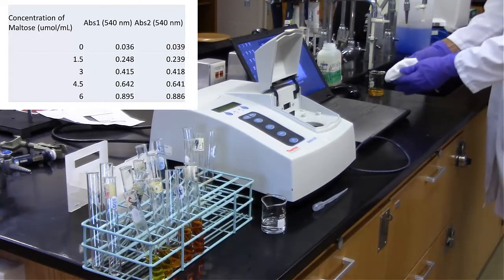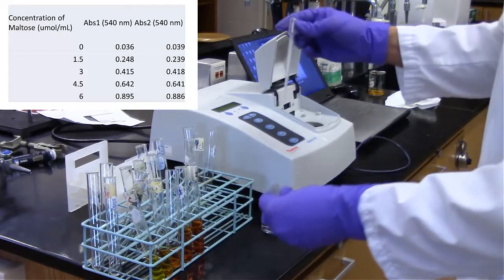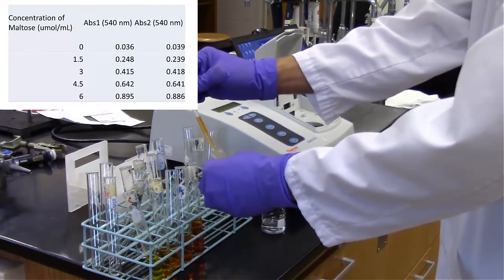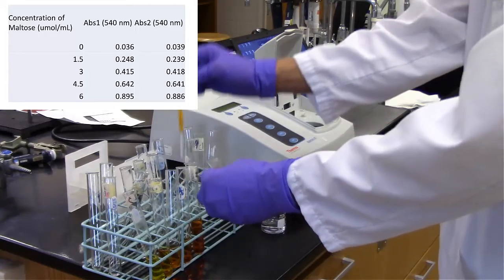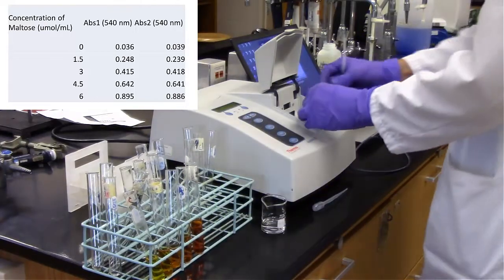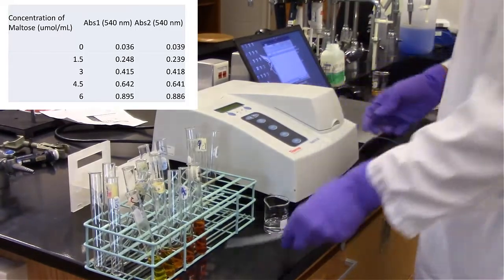Make sure that you have your concentration of maltose as your x-axis. So you want your x-axis to be in the range of 0 to 6 micromoles per milliliter, and then your absorbance values are going to be on your y-axis. You're going to enter all those absorbances and make sure you combine that data set when you fit that with the linear standard curve. So make sure you also show the y equals mx plus b equation, as well as your r squared value on that graph when you present it for this lab report.